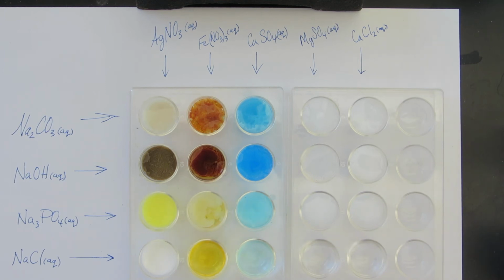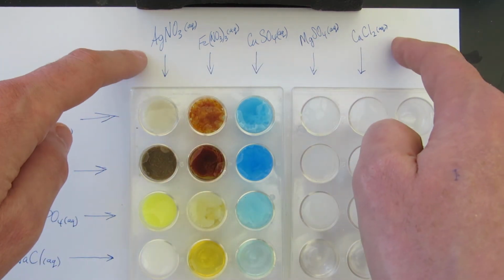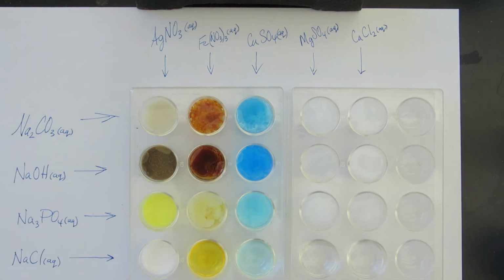All right, those are some precipitation reactions. This is what the stuff looks like in a chemical equation, right? You saw what it was. It was just a clear solution. You saw the original solutions. This is what you see on paper. You saw what it looks like with the color and in 3 dimensions. All right, so let me do a little close-up.